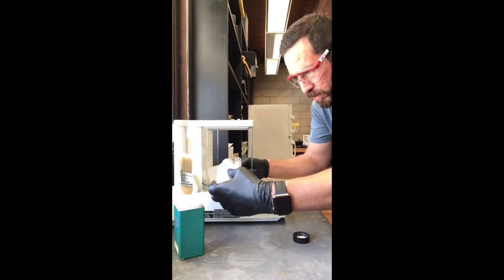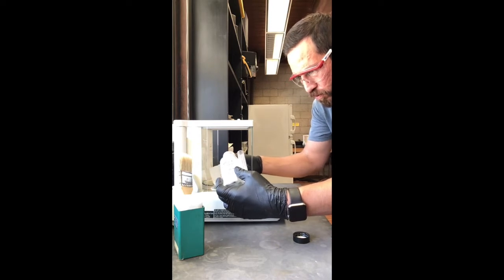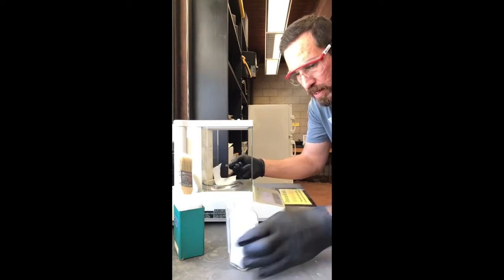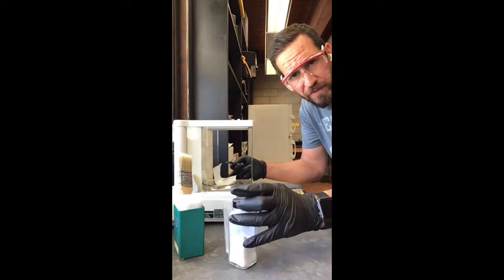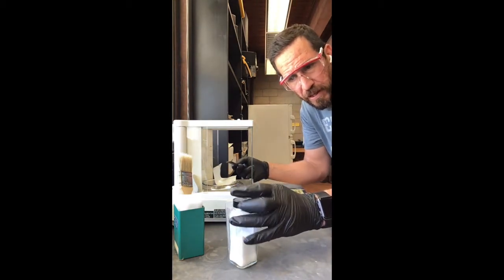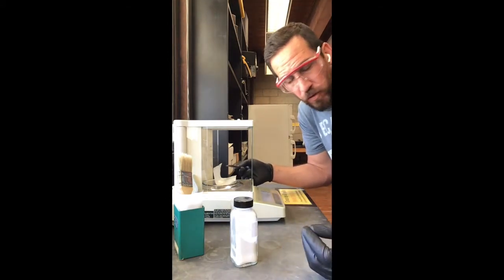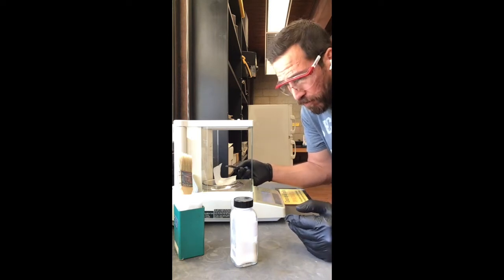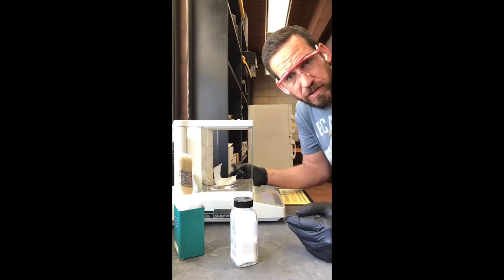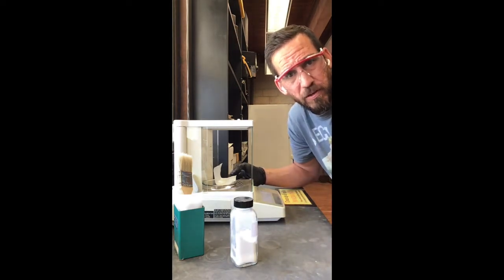And all right, so there we go. And it doesn't have to be perfect. So most often you don't have to get exactly whatever your mass is. You just really need to record the exact mass that you've obtained. Okay, so it does need to be close for a lot of reasons, but just try your best. Don't spend 5 minutes trying to get exactly 0.070 though.